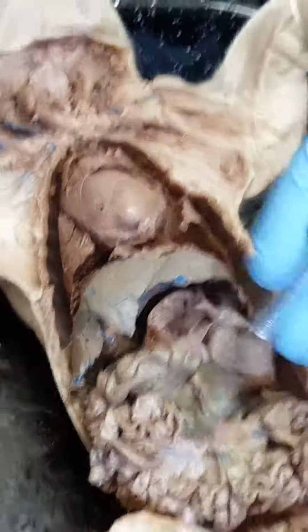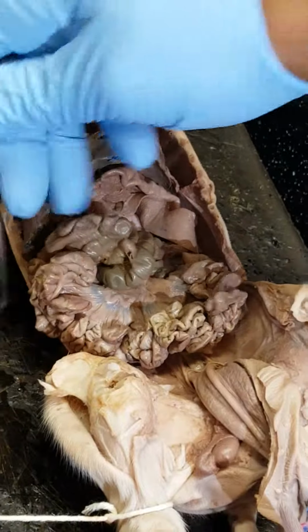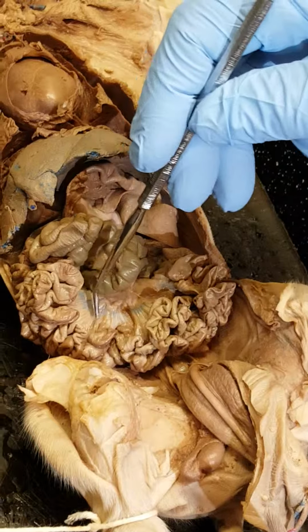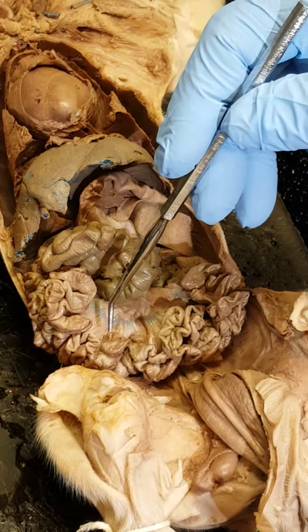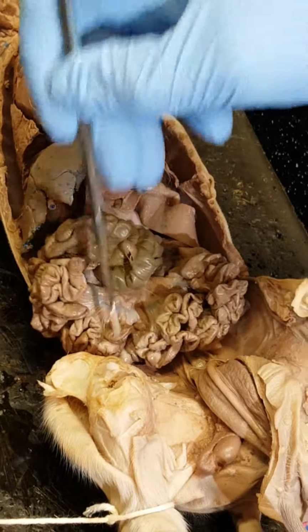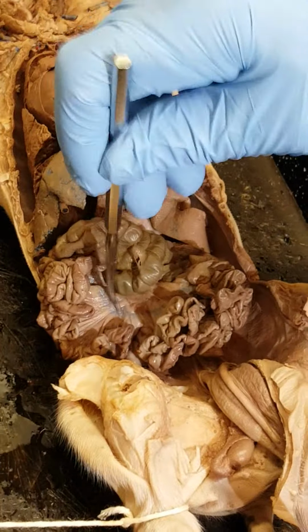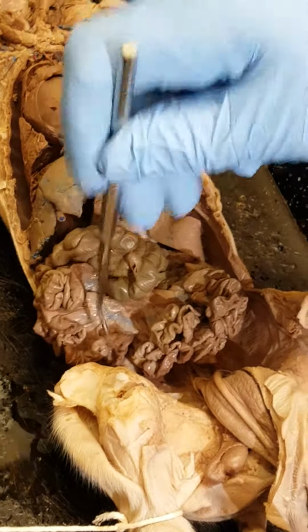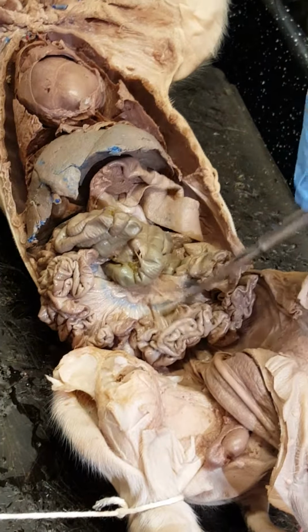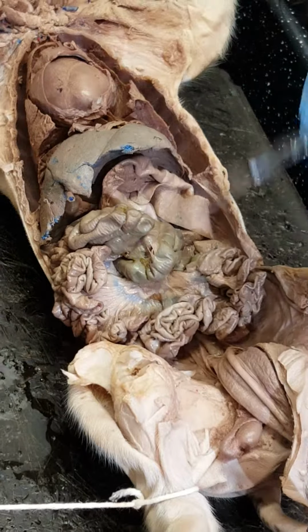Okay, down here, the biggest thing to look at would be this webbing that you see here. That's called the mesentery. You should see this in your lab manual. When you open up your lab manual and look for these, you will see that. See that right here? Everyone sees what I'm talking about? That webbing is your mesentery. That's your mesentery right there, right?